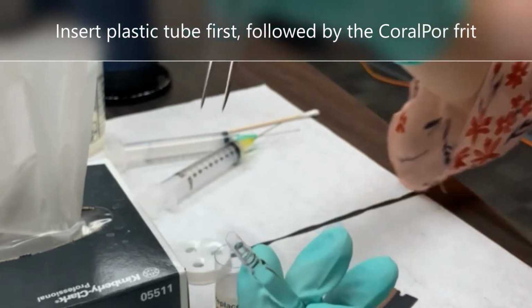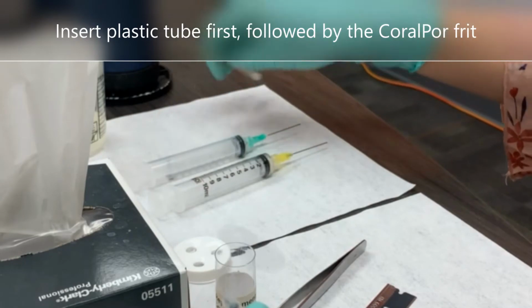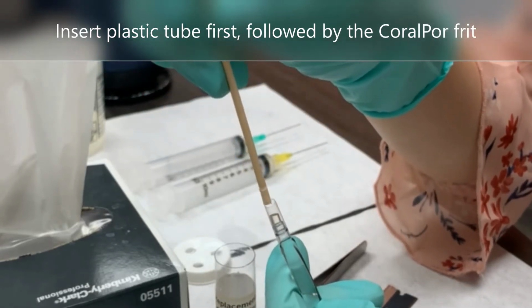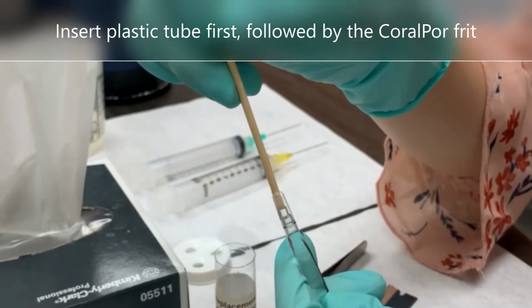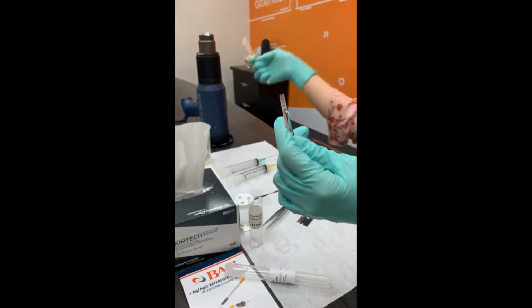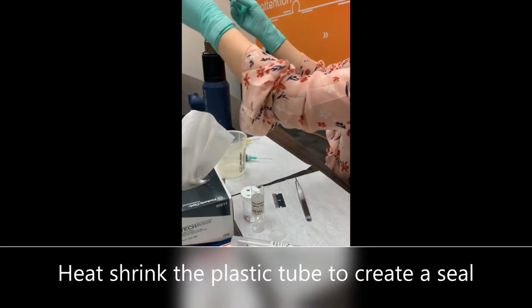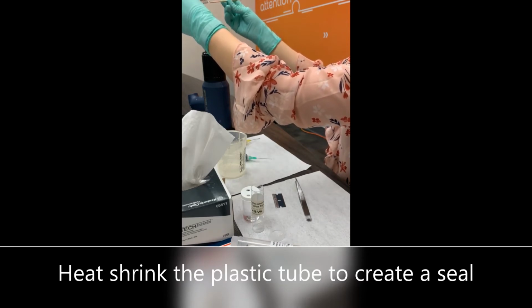Now, to prevent it from moving while you're heat shrinking it, you can grab a piece of wooden stick or anything that would fit inside the plastic tube so that you could lightly press the CoralPor Frit against the electrode while you're exposing it to the heat gun. So I'm going to turn on my heat gun. Now slowly rotate while exposing it to the heat.